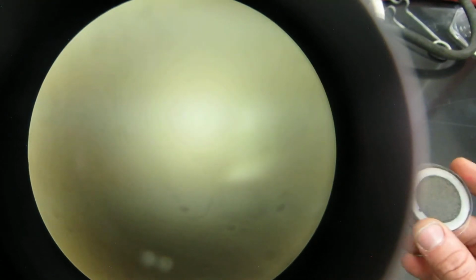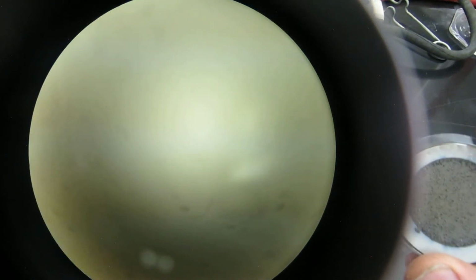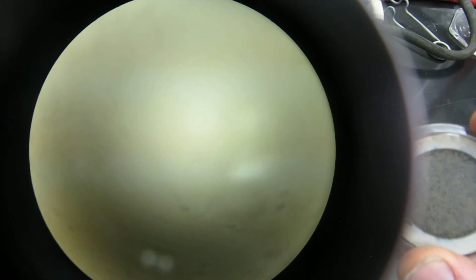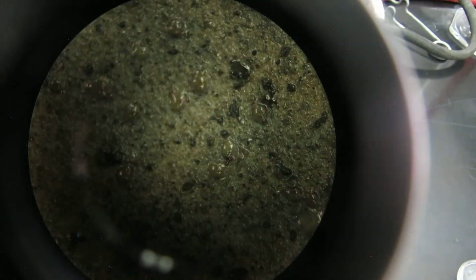So what we have is this membrane filtration method actually produces some colonies. You'll see some colonies here. When you see it just like this, it just looks like a big black or big solid color there. So for example, when you look at it in the dissection microscope here, you'll see that it actually has some sediment there and some colonies growing.